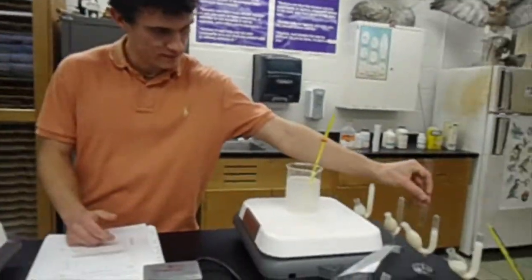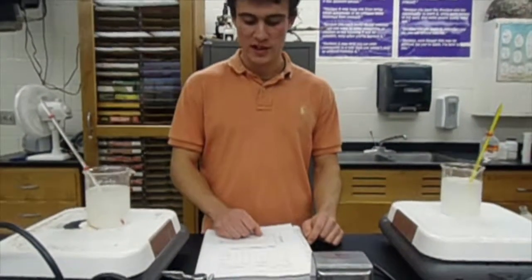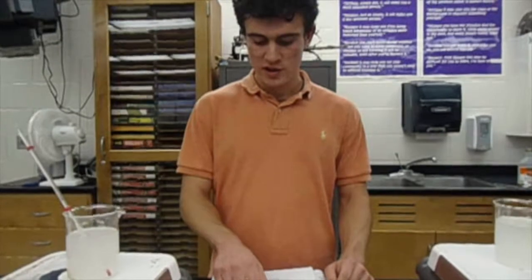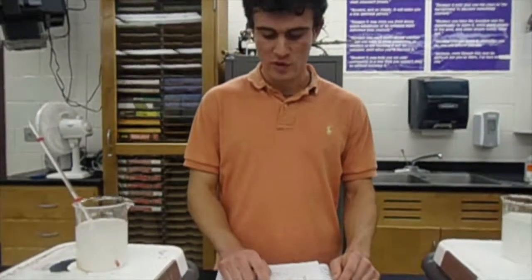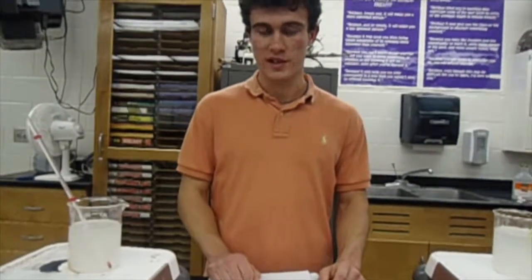The warm bath was rapid at the beginning with a big 44 millimeter jump, then somewhat gradual for a while, and then it started to slow down. This one was different though, and we'll get to that.